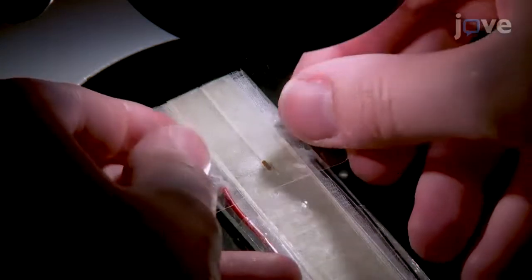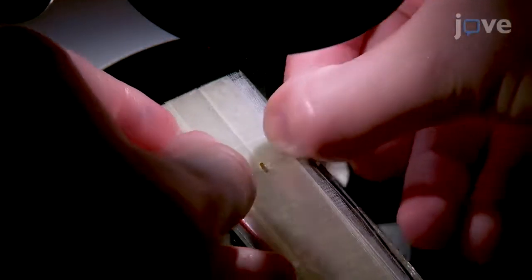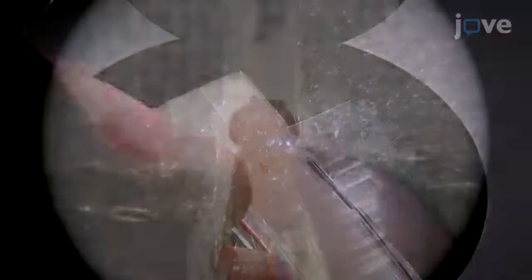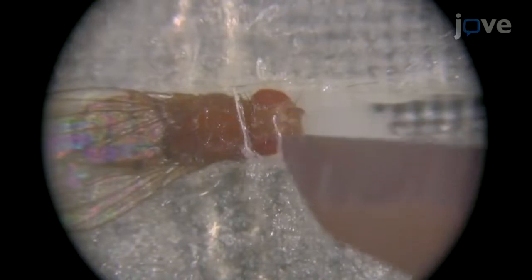Fix the fly in place with clear adhesive tape and use a surgical scalpel blade to cut a window in the tape around the head, leaving the antenna covered and only the anterior-most portion of the thorax exposed.